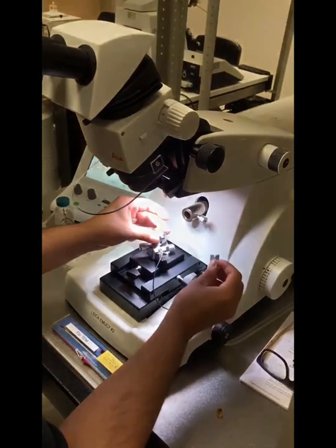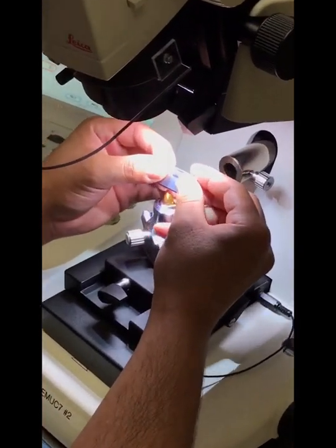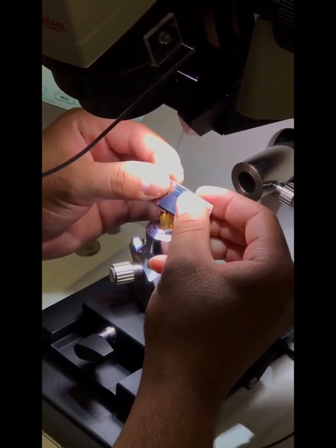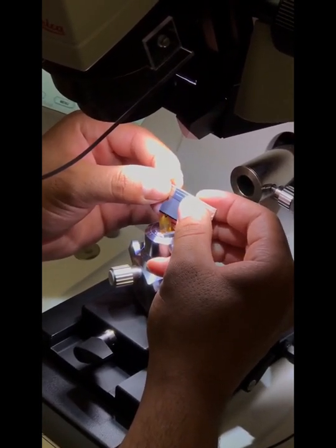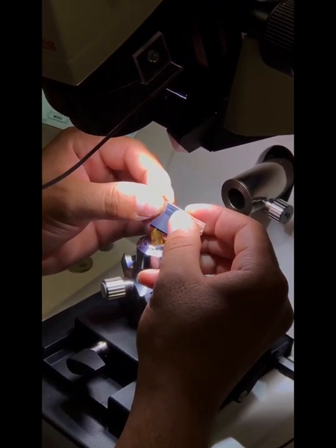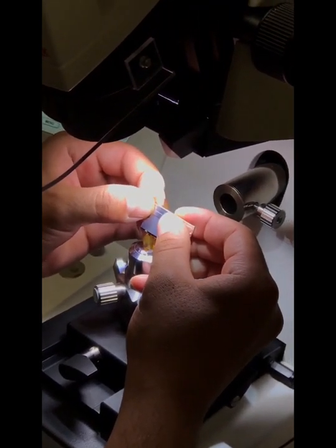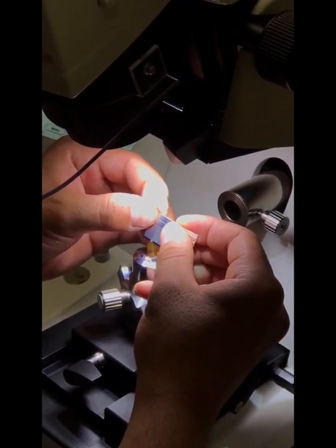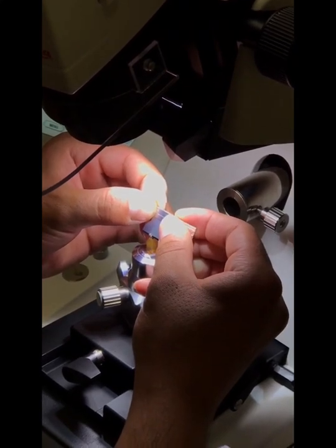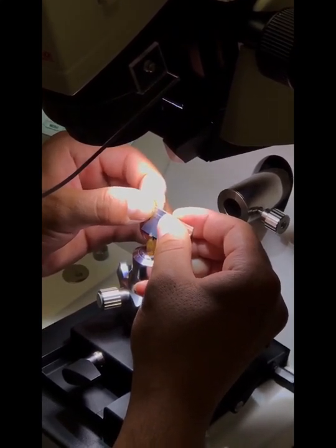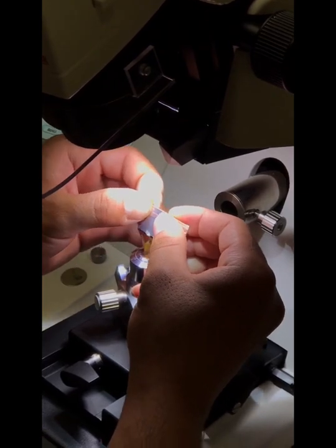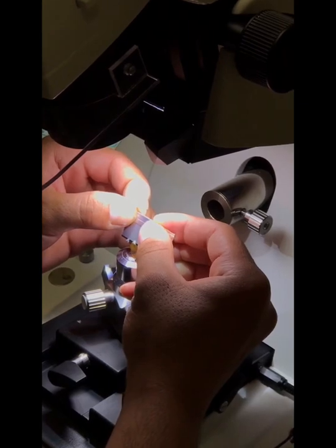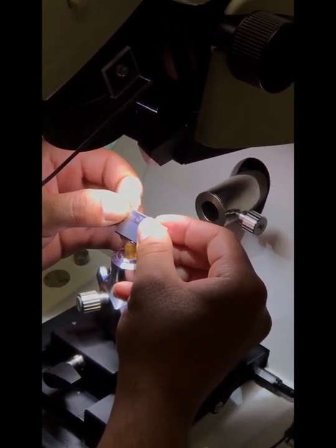And now I'm just going to start trimming the face. I like to start out with the left or right side of the razor. That way you can go along the razor as you're cutting to keep the razor that touches your face that you're trimming with nice and sharp, because it dulls out after each cut practically.